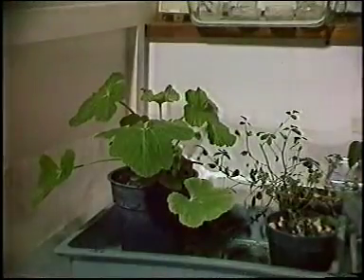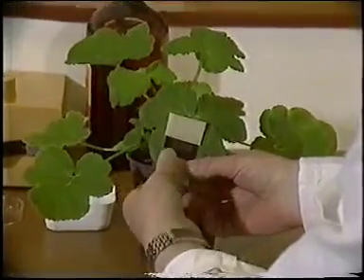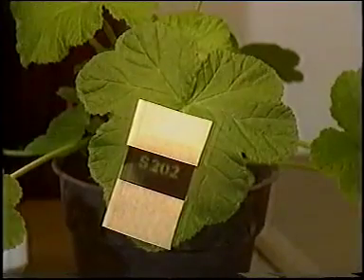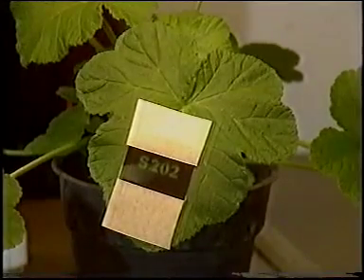To do this, we first of all kept the leaf in the dark for some time so that its starch reserves were depleted, and then attached an exposed photographic negative to one of the leaves and left it in the light for a few hours. The negative acts like a mask, and where light passes through the clear part of the negative, then photosynthesis occurs and starch, a reserve carbohydrate product, is formed.